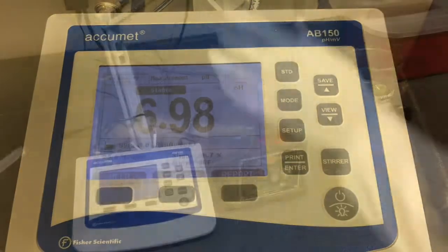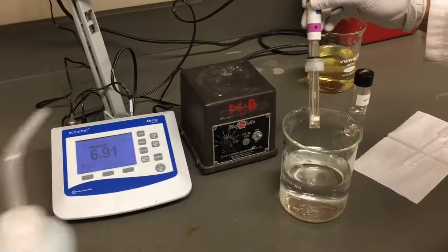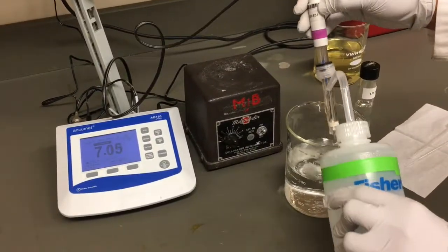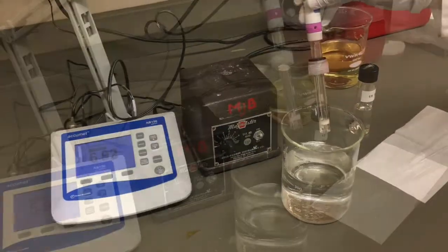Once you've obtained a stable desired pH, you must perform a final rinse of the probe with clean water and be sure to return the filling port to the closed position for storage.